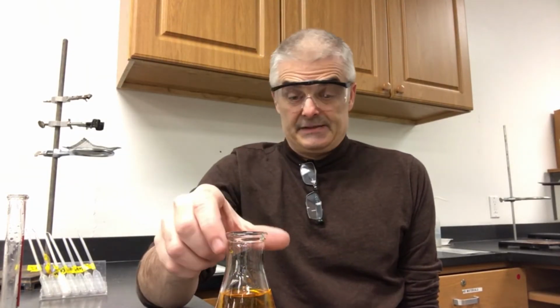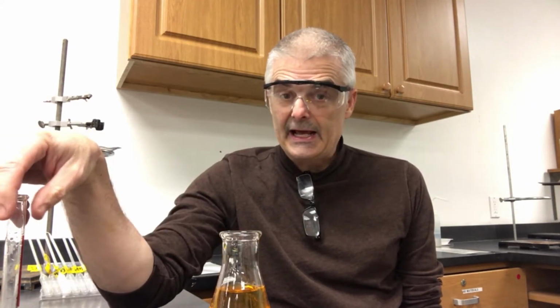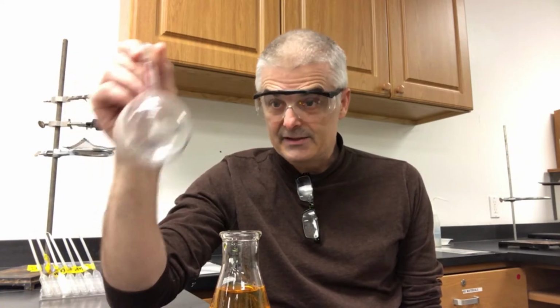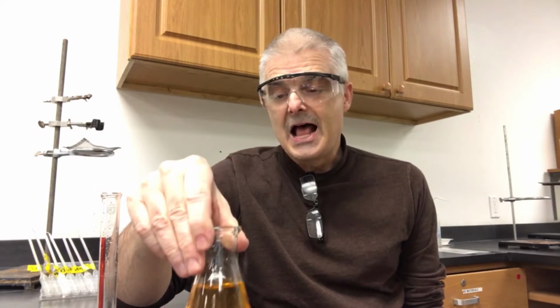So when we're doing dilutions, how do we actually physically do it in class? Well, the answer is that we have a concentrated solution. Let's say I have this orange solution, chromate, and I want to dilute it by adding some water. But we don't want to just add a little. We want to know exactly how much we add.